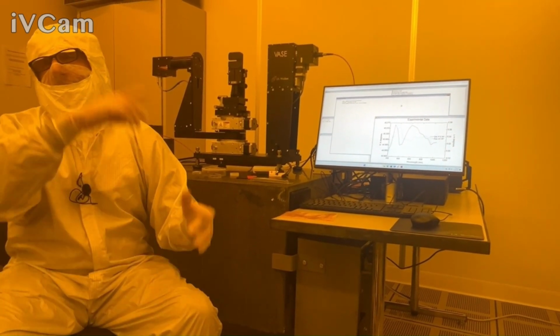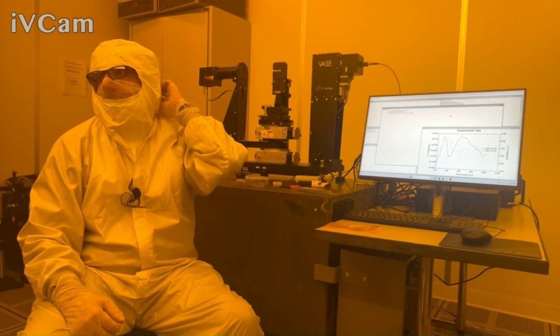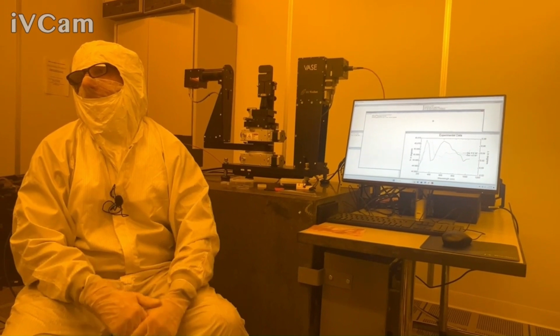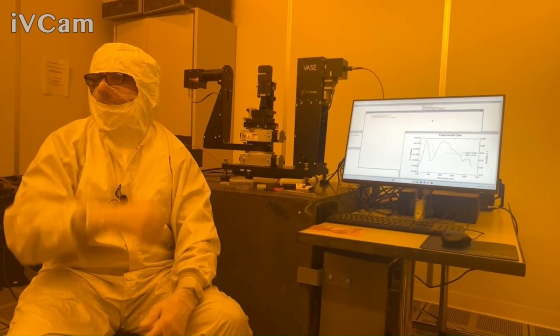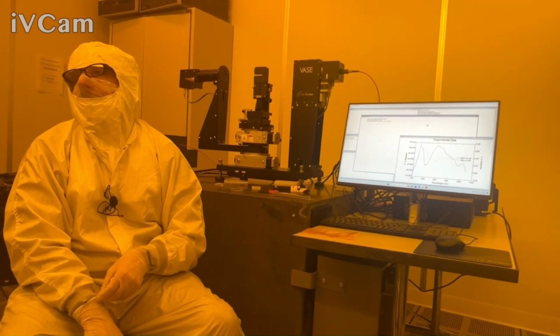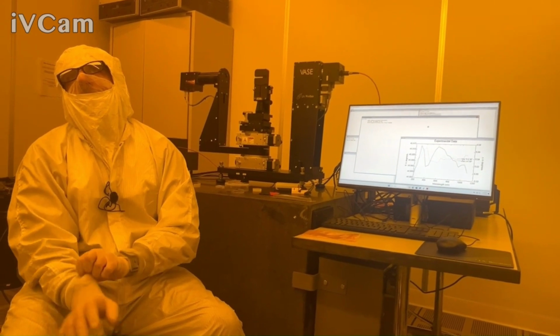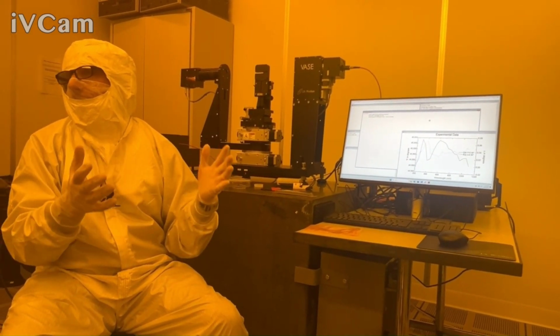And again, if that's adequate to give you the information you want, great. But you were not doing things on glass, then, I assume. No, on silicon. On silicon, and you had films thick enough to have interference oscillations usually. Yeah, usually we had a thickness range from 250 to 500 nanometers. So again, I guess my comment there is, you will likely get almost the same answer with or without for a lot of those materials.